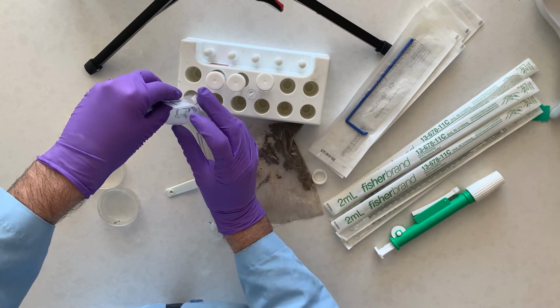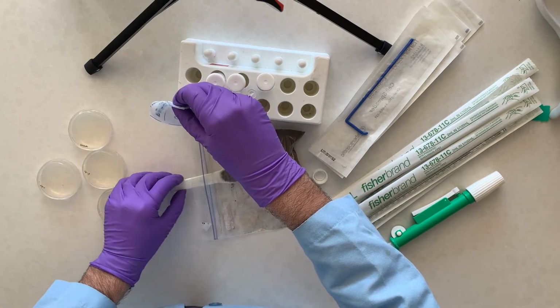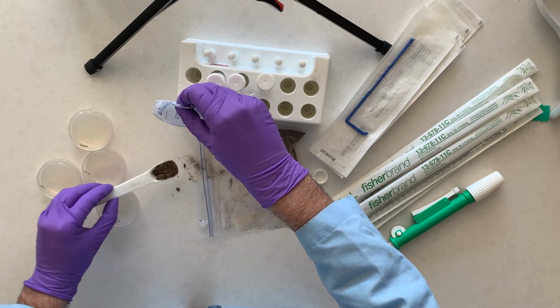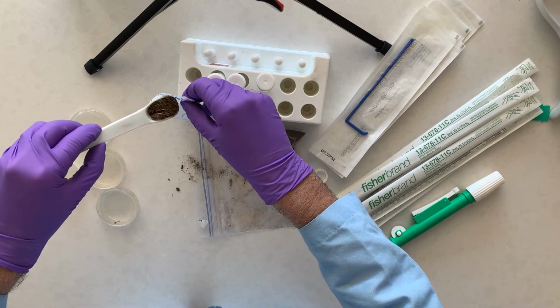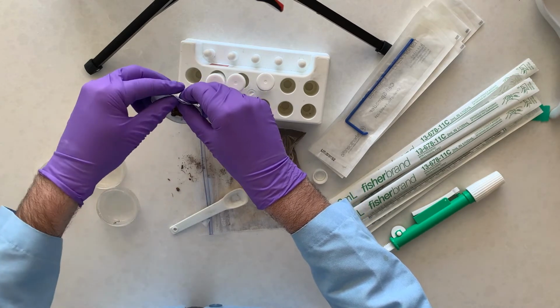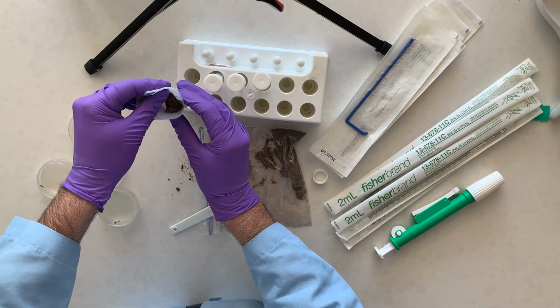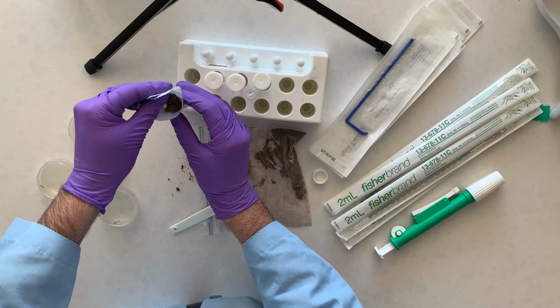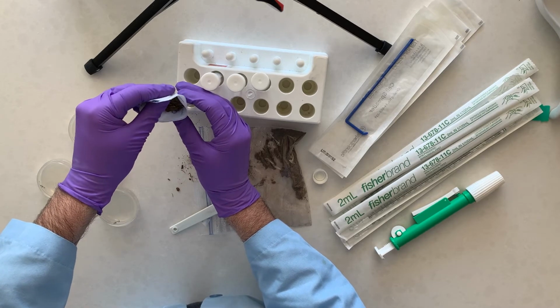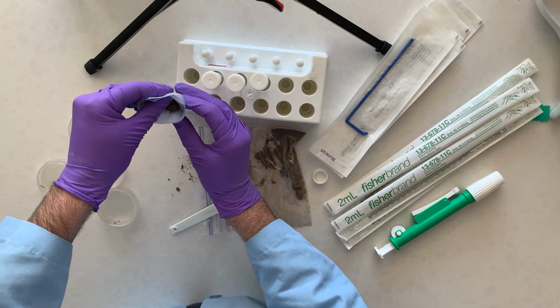So what I've done there is I've taken a piece of the wax paper that comes with parafilm, so not the parafilm itself, and I just fashioned it into a little bit of a funnel that allows me to pour the manure in a little easier than just the spoon trying to go directly into the tube itself. So it gets caught a little bit in that funnel, but if you wiggle it around and if you have a large enough hole in the bottom, it will eventually come out.